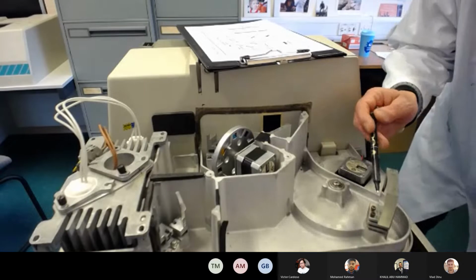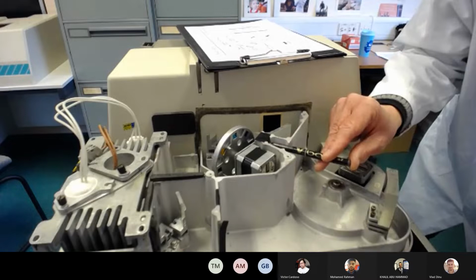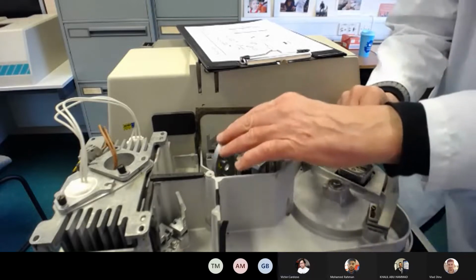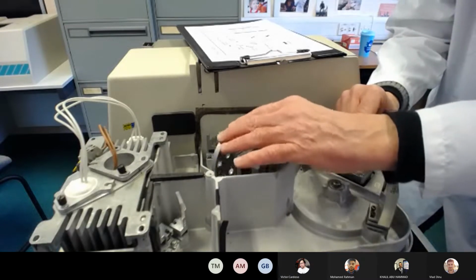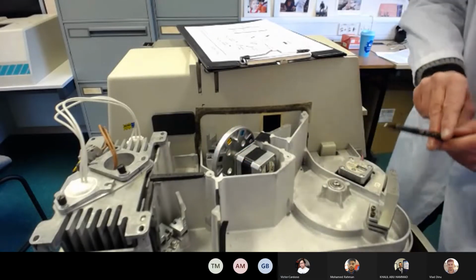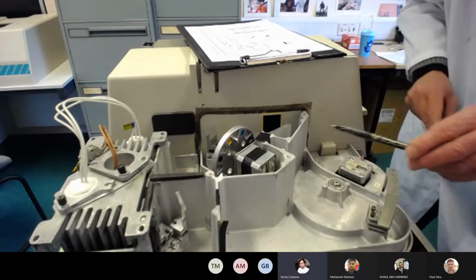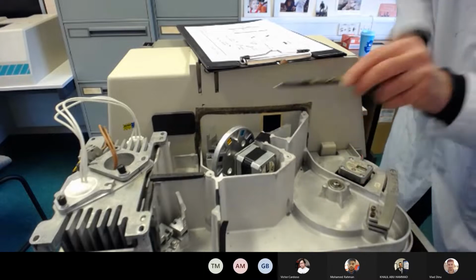So the light goes from the grating through what's called an exit slit, and then this wheel has optional additional filters which you may want to use depending on what you select on the control panel where you do the settings, which can be linked to a computer, and then via a filter or not, then through to this.